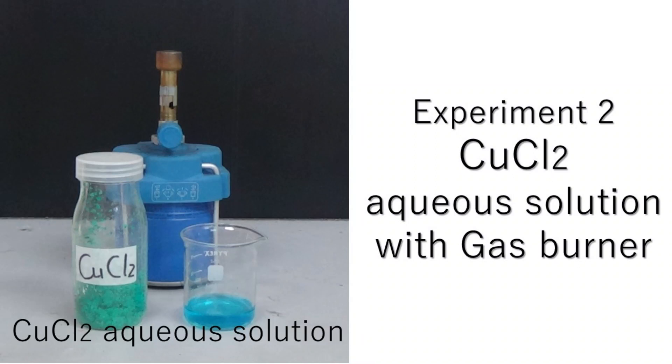If copper chloride aqueous solution is used, the flame reaction of copper can be observed clearly.